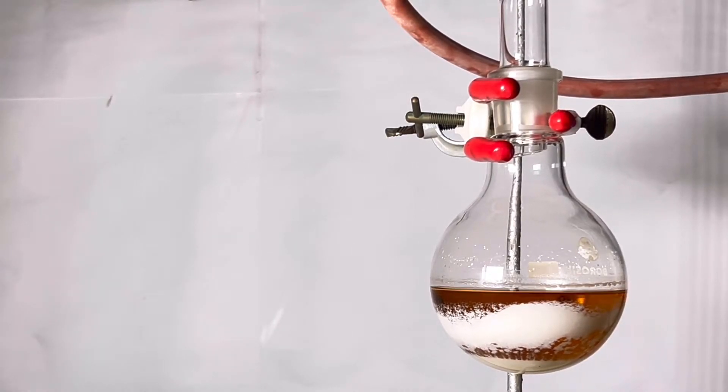After 8 hours the reflux was stopped and the flask was allowed to cool down to room temperature. A lot of sodium bromide precipitates out which can be removed by filtration.